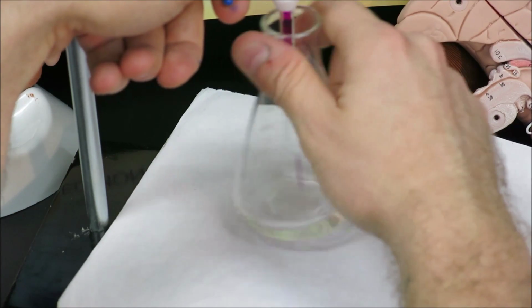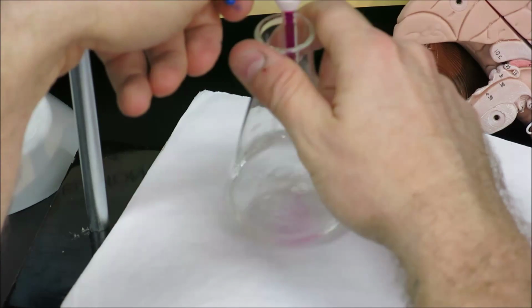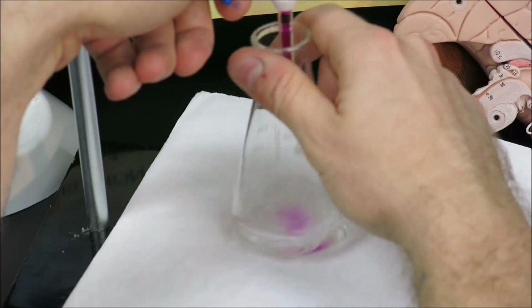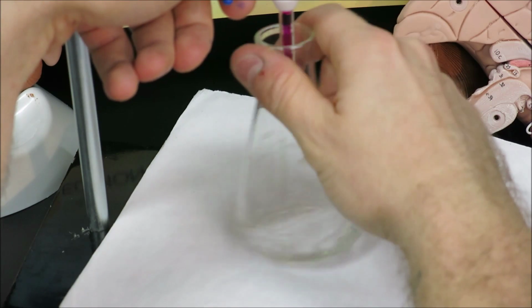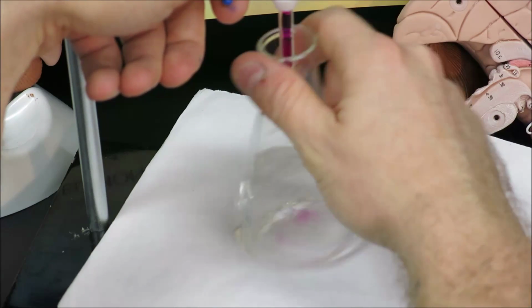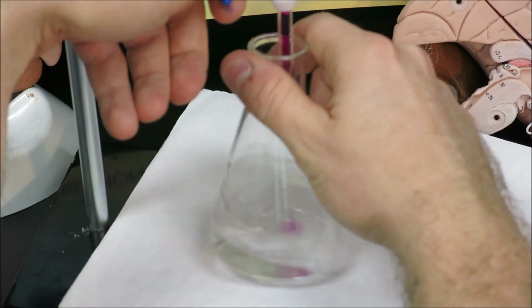Very important to swirl. Without swirling, the solution may look pink until you swirl it, and some of the peroxide does react with the permanganate and the color fades. So it's very important to swirl. And in our case here, to find a pink endpoint, that white piece of paper underneath is very essential, as on black we would not really see a change from colorless to pink.